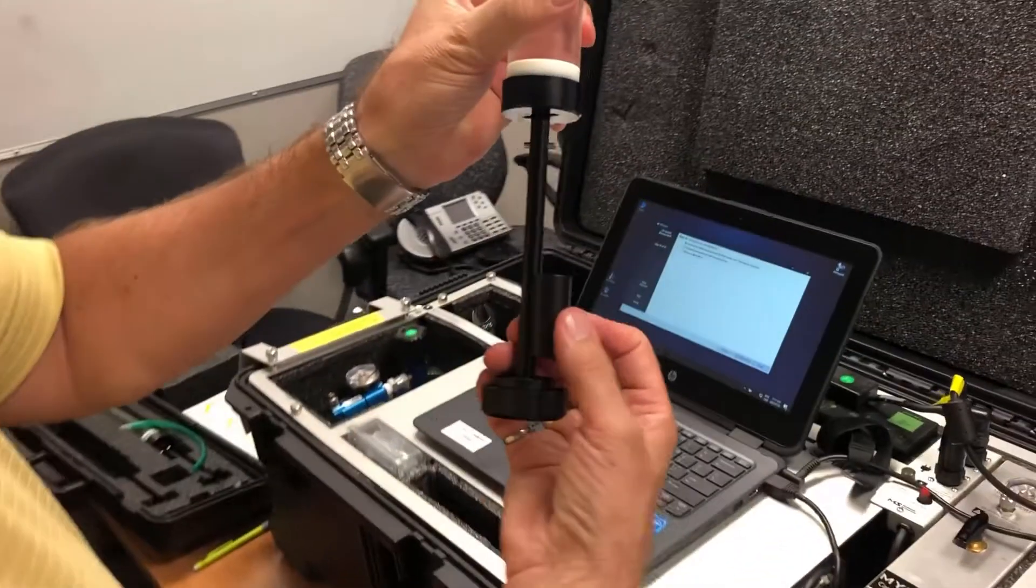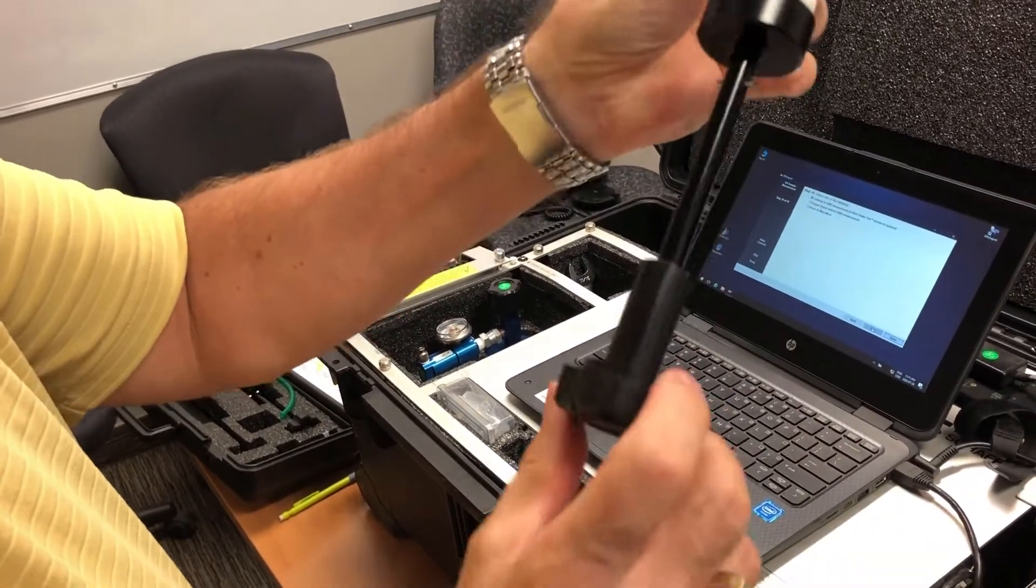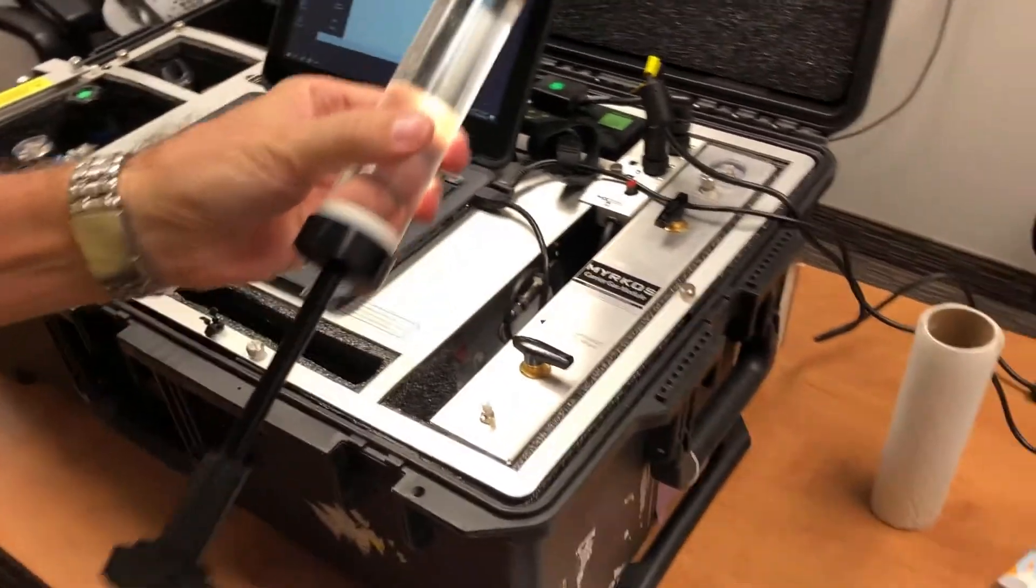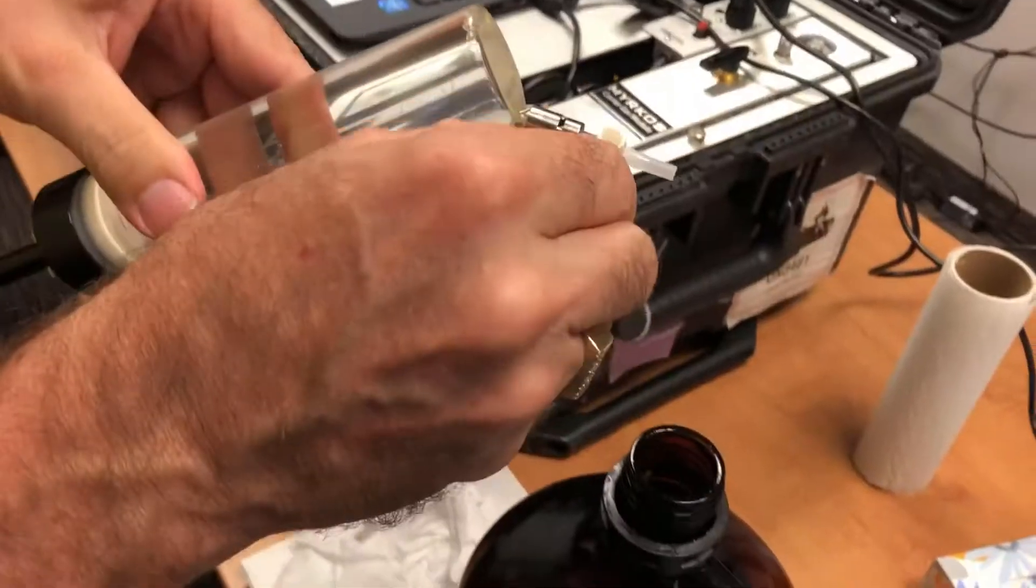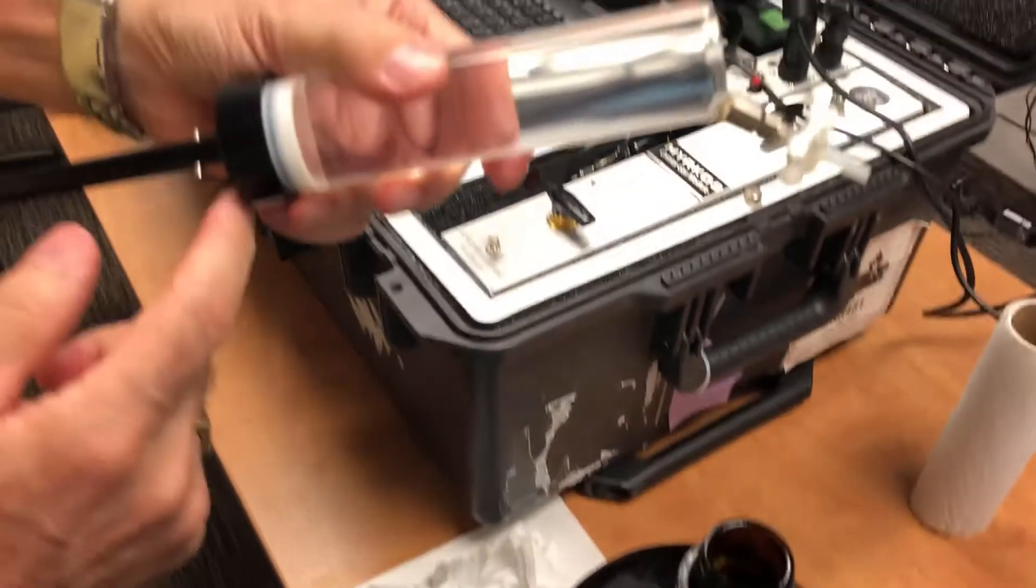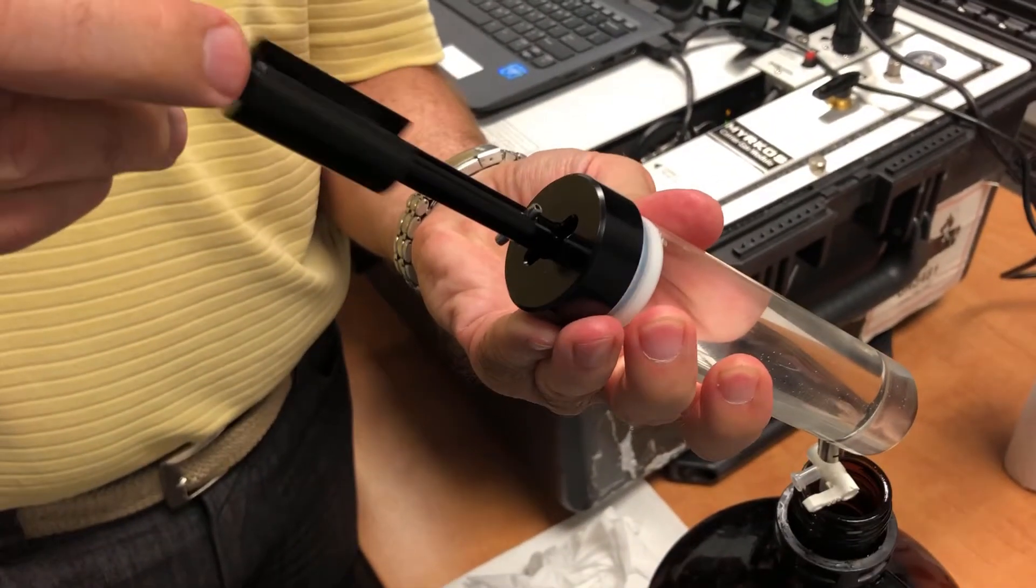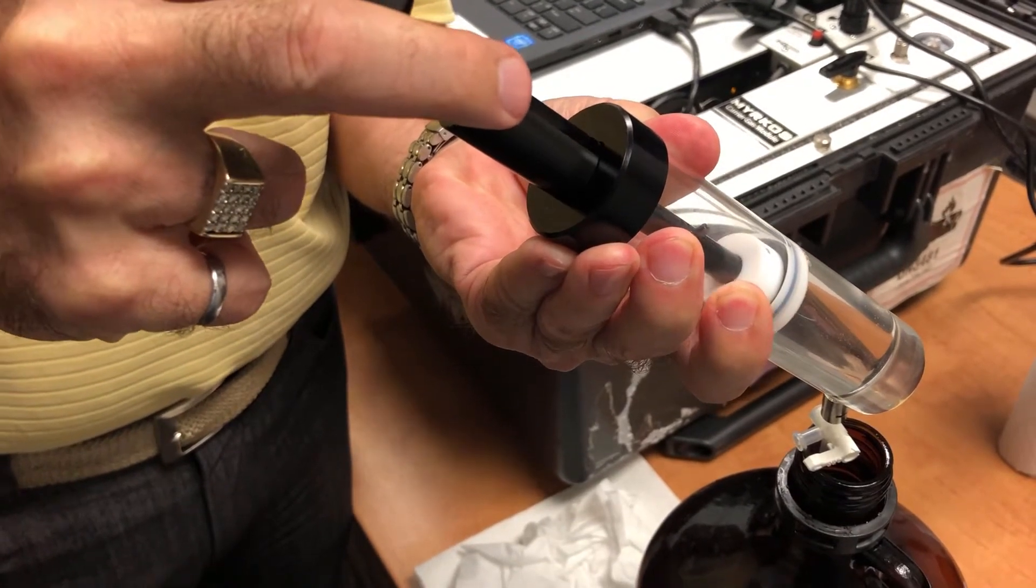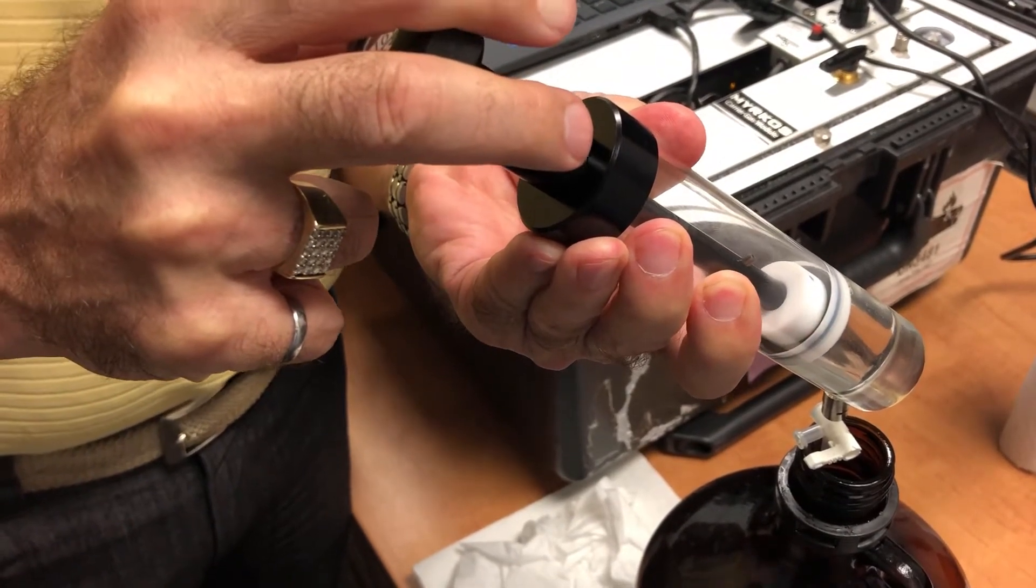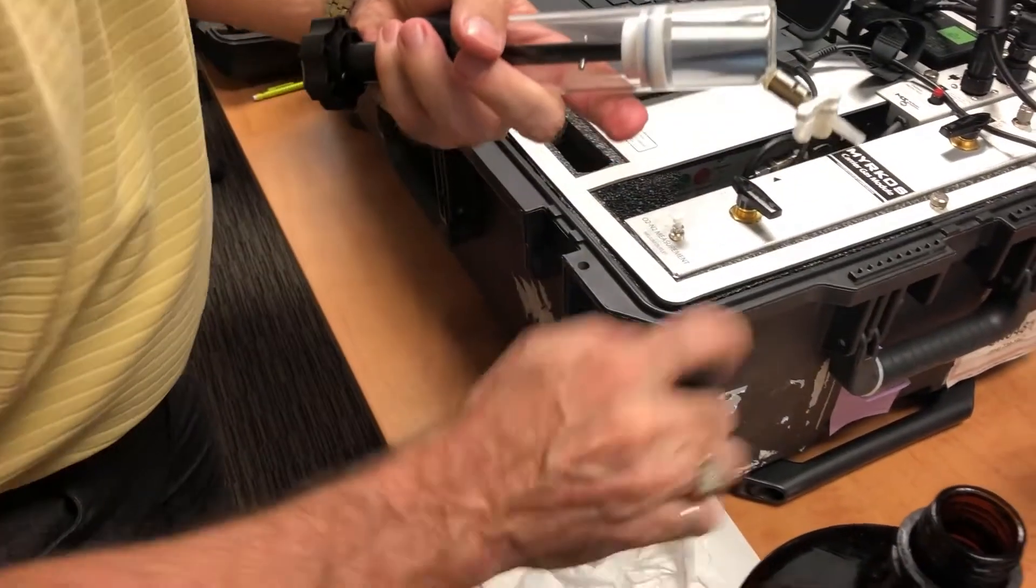So what we do is we put this onto the plunger, and we're going to remove a large portion of oil. So this time, we just push out all the oil until the plunger hit the bottom of the syringe. For the oxygen-nitrogen measurement, we keep only this amount of oil compared to the 7-gas.